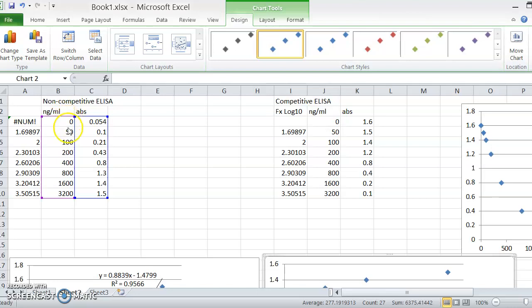This is your nanograms per mil of whatever it is you're measuring. It could even be milligrams per mil, it depends what you're measuring. I've just set up a dilution series of a two-fold dilution, so 3,200, 1,600, and so on. So it's a two-fold serial dilution. And let's say we get an absorbance of, you know, very low up to very high.